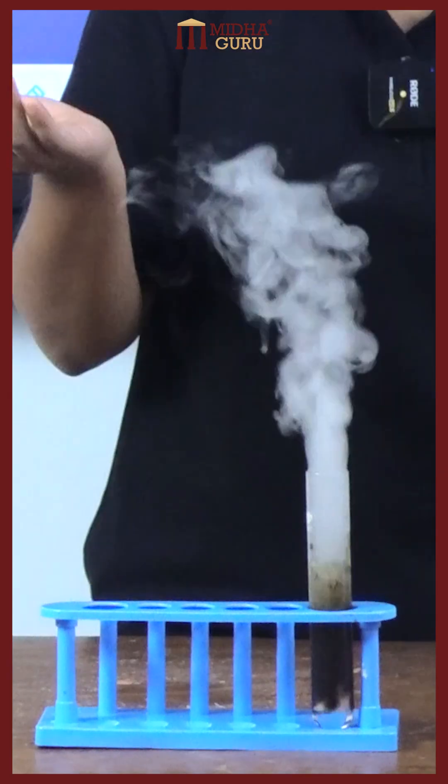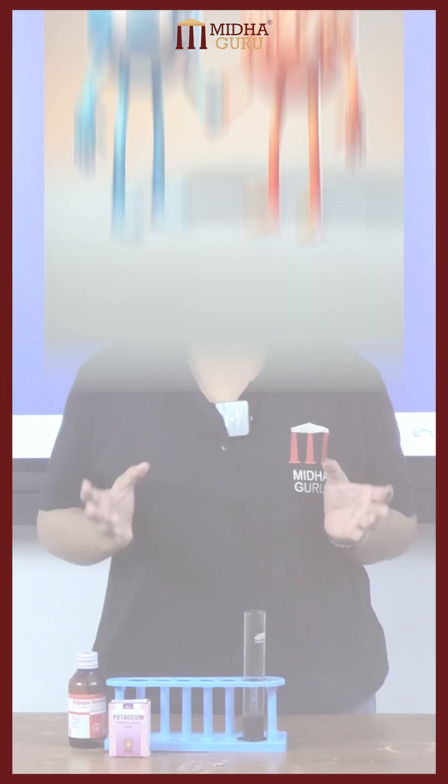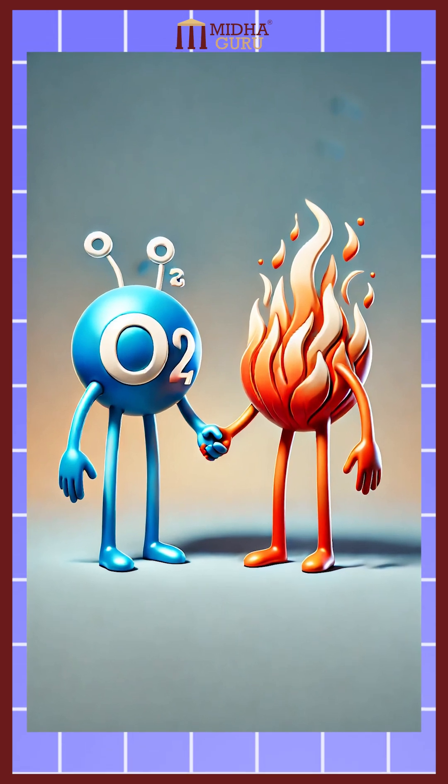When I bring the lit incense stick near the test tube, it catches fire again because of the evolution of oxygen gas. Oxygen gas, we all know, is a great supporter of combustion. For more informative and fun science content, follow Midha Guru.